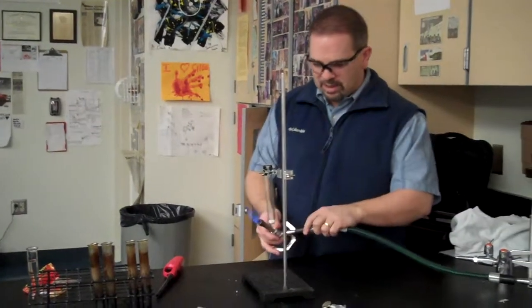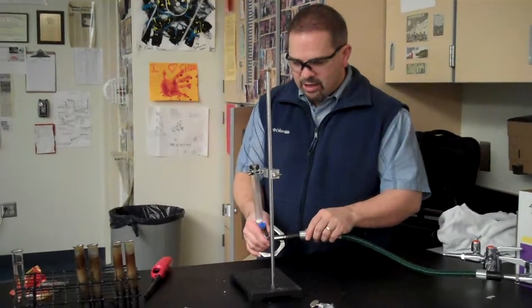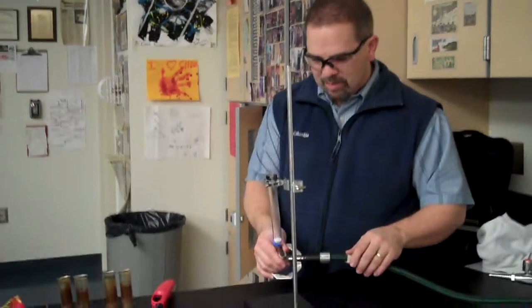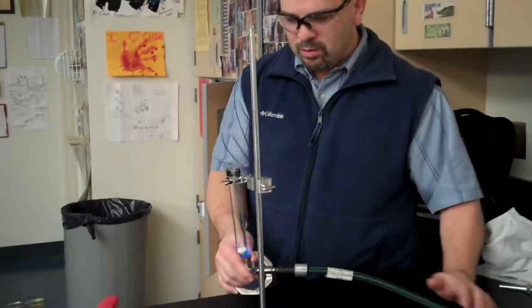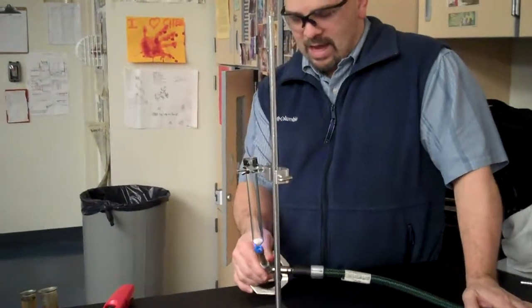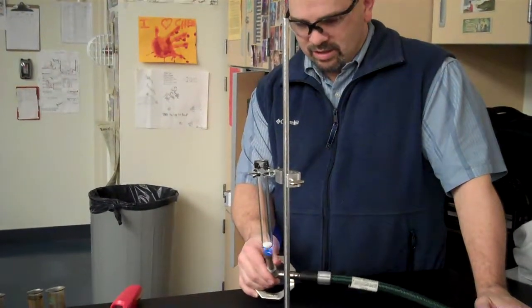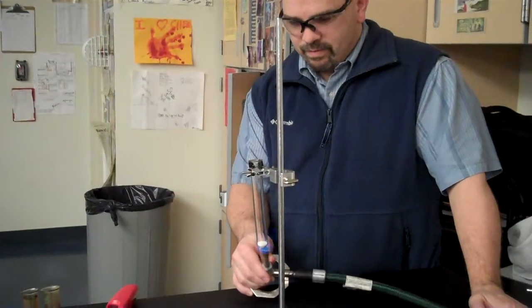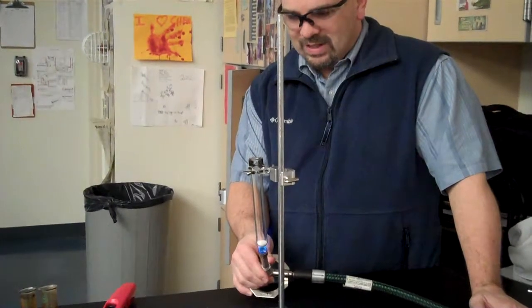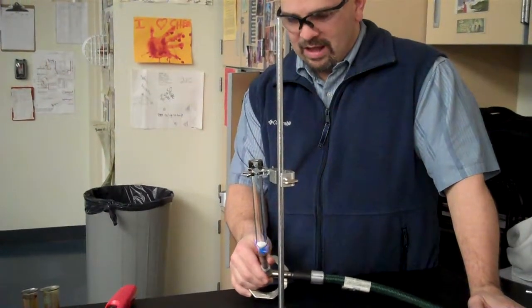So what I've got in this thing is potassium chlorate. And you guys know ionic compounds melt at a high temperature, right? But it turns out the potassium chlorate will actually melt with the Bunsen flame. But it's pretty hot, 1,300 degrees Celsius. Yeah, so it's melting.